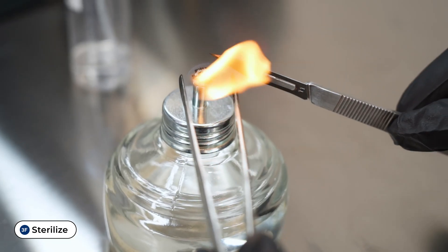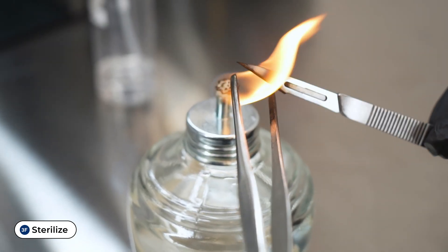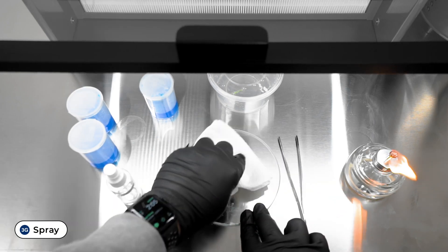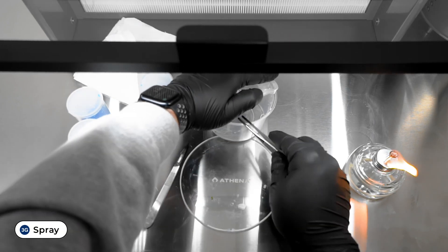Sterilize the forceps and scalpel blade with the alcohol burner and spray the work surface with alcohol after each cutting. Repeat these steps for each explant you want to create.